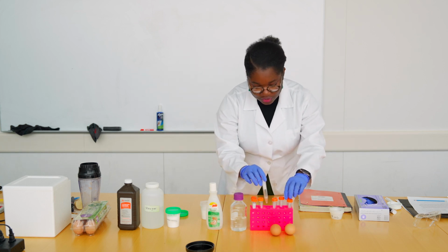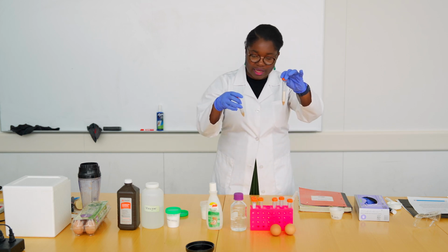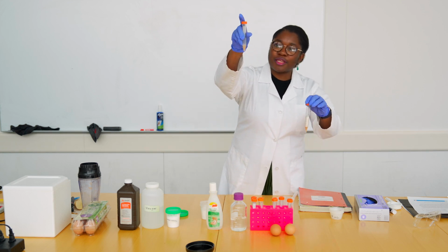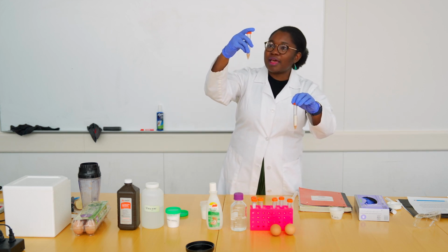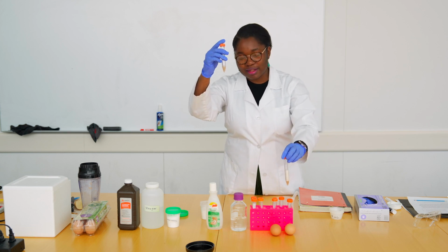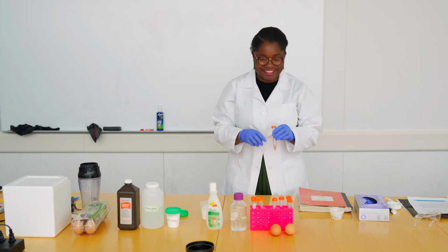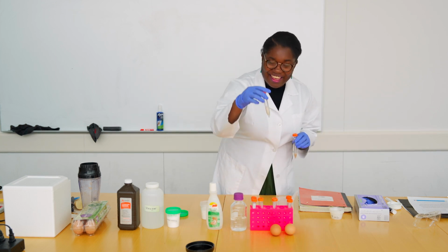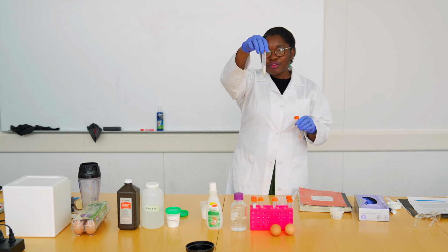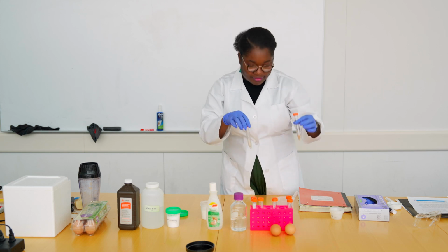And you could compare it to what you have. So this is our first tube, the potato juice and the hydrogen peroxide. And in our second tube, I have potato juice and salt. And there is really not a real reaction, because all the bubbles that formed in here are bubbles of my doing. They're not coming from any reaction. Even if you compare with just the potato slice, you still have quite a bit of bubbles, smaller bubbles, and in the salt there is nothing.